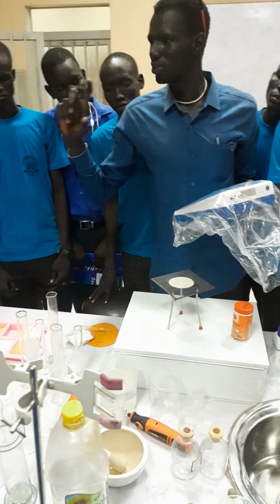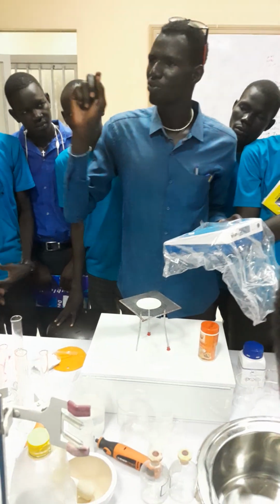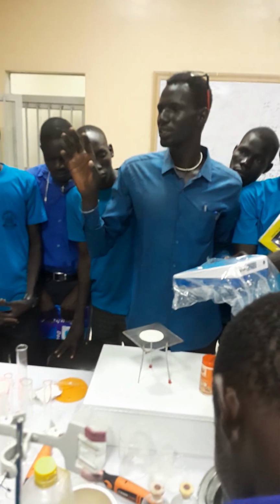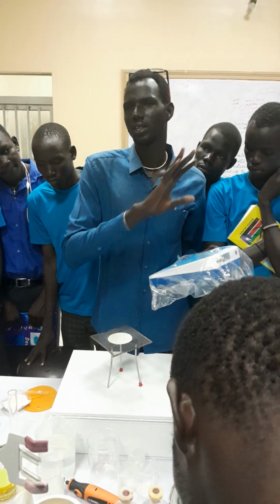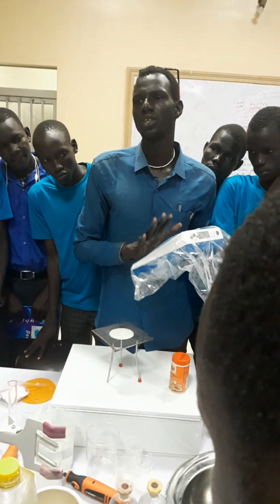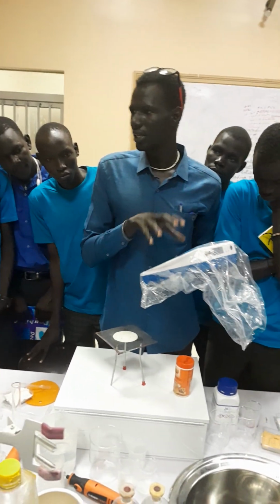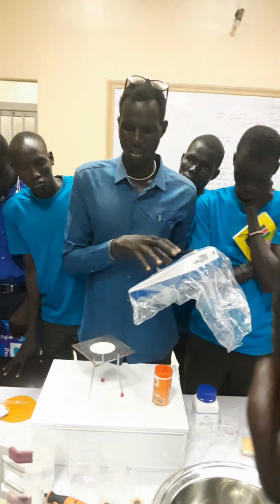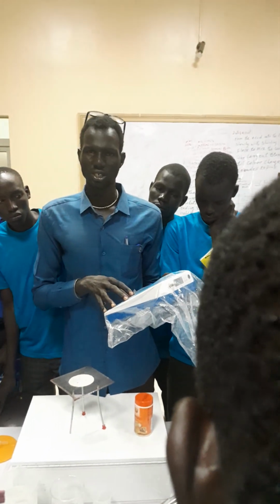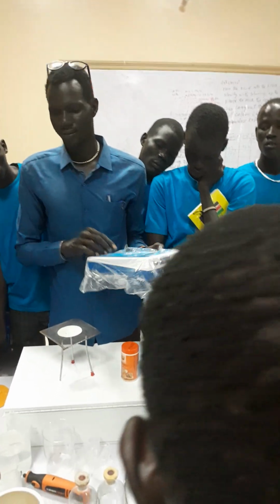When you see that, it shows that there is a presence of base. And when you find the pH is exactly 7.0, that means it is neutral. If it is neutral, it is water. The pH of water is 7.0. The equipment used for measuring the acidity, alkalinity or neutrality of any substance is known as the pH meter. It is called an auto pH meter because it has a battery inside.